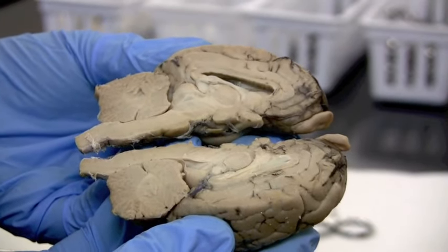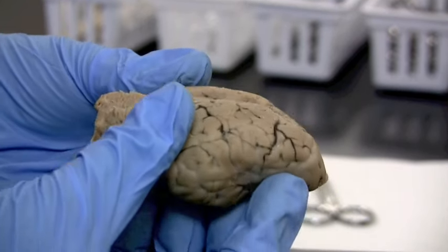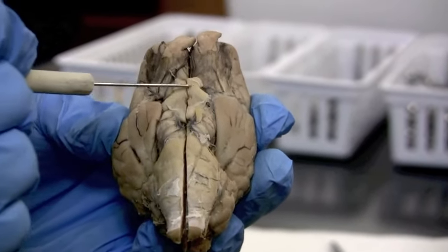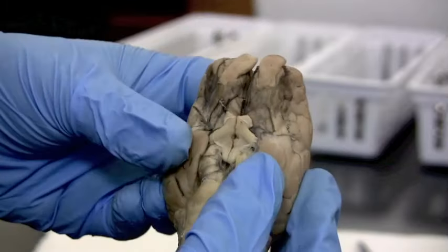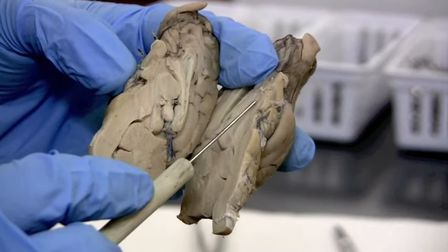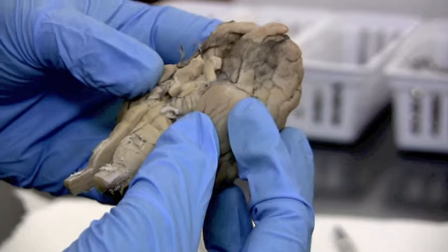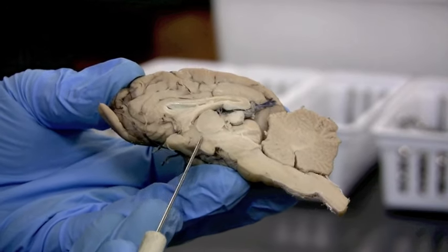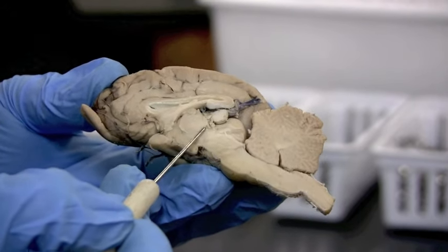Here we are with our mid-sagittal split of the sheep brain. If we remember all those parts and put it back together, you can see just some big landmarks: the optic chiasm here is your landmark — right behind it is the infundibulum. Therefore, if we open it up, right in those locations is where you'll find the hypothalamus, and the big round thalamus above it. The optic chiasm cut again, the mammillary body — in between is the hypothalamus. Above it is the thalamus, right in the middle of the brain.